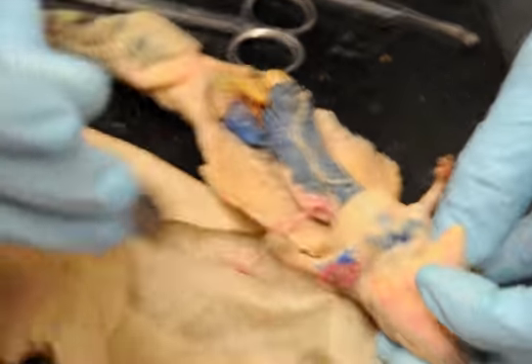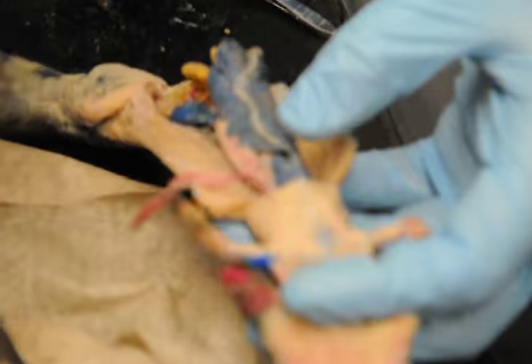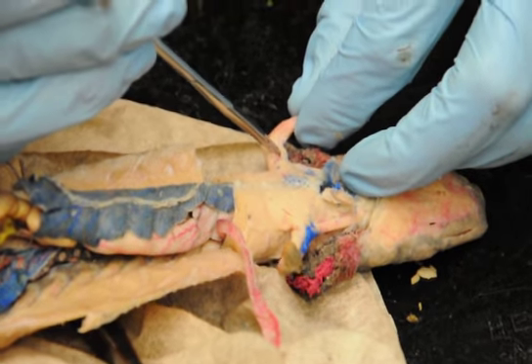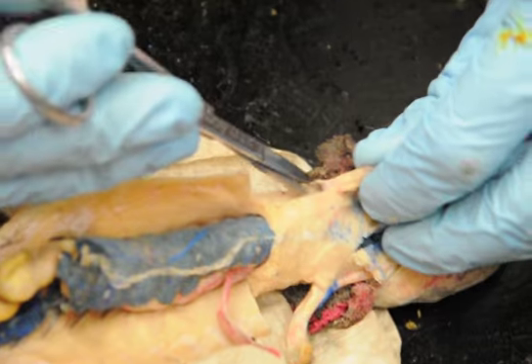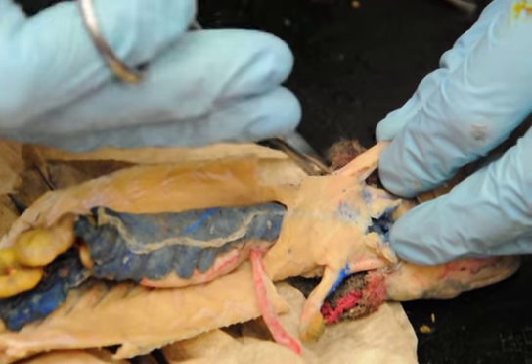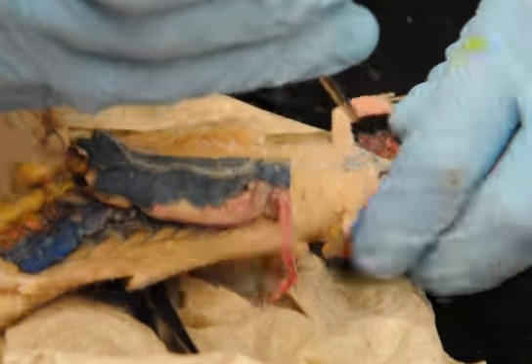But I'll get cheese on me. Oh, the last two things are there's two vessels you can see in the arm. And Frank corrected me on this one last time. I thought there was only one. So right between the two muscles here, you're going to see the brachial. And in the armpit, depending on the animal, or if you remove the scapula, you can see the axillary. You won't see the subclavian on the mud puppy.